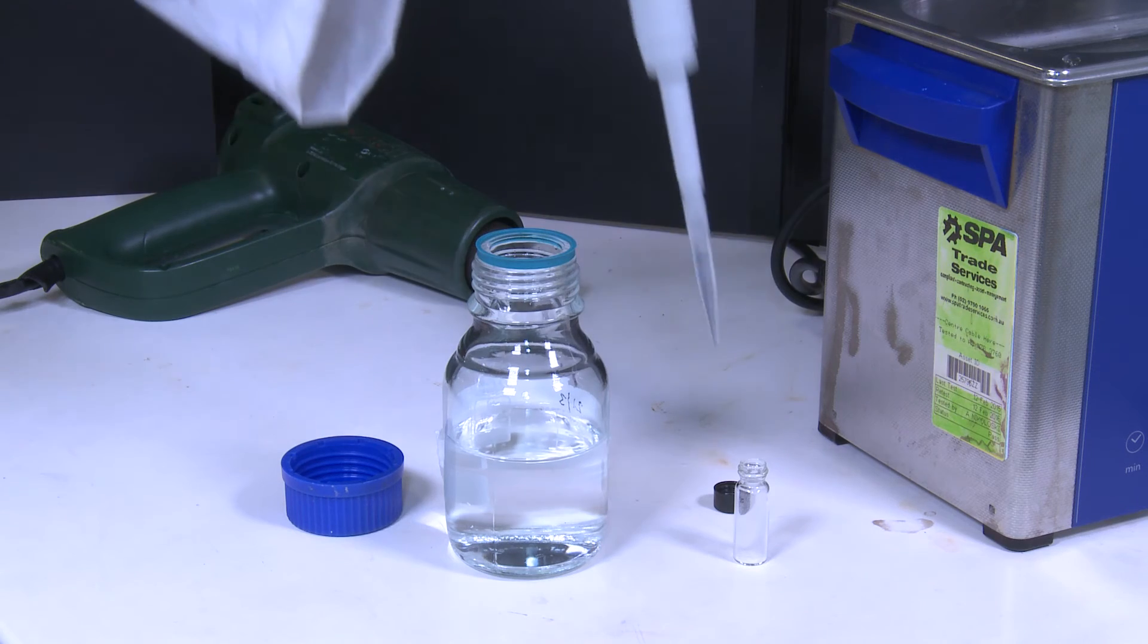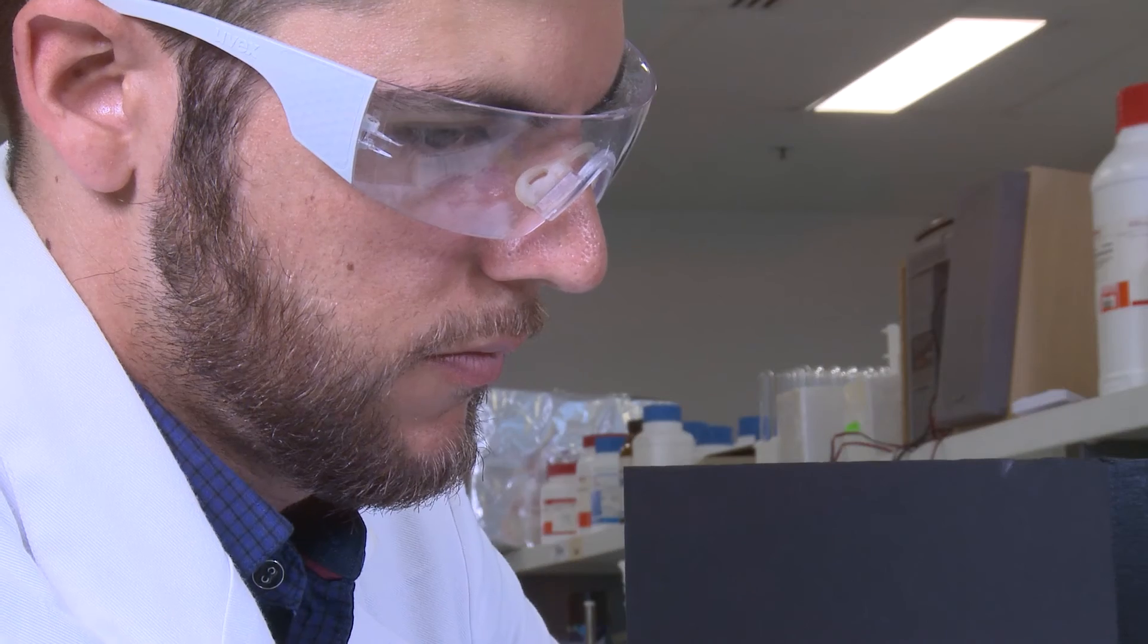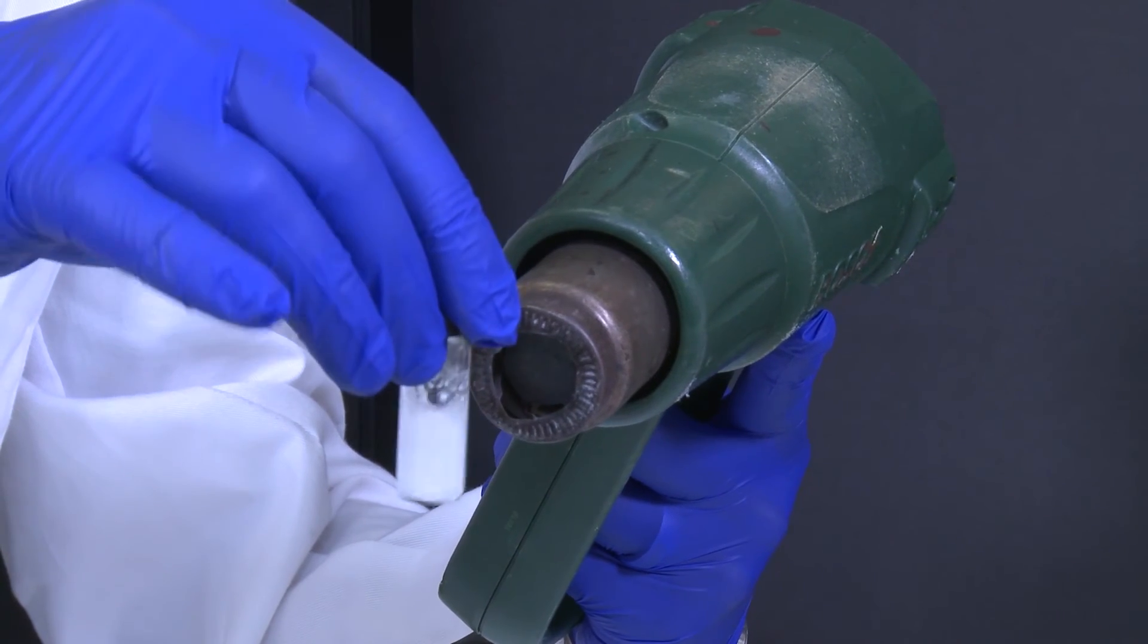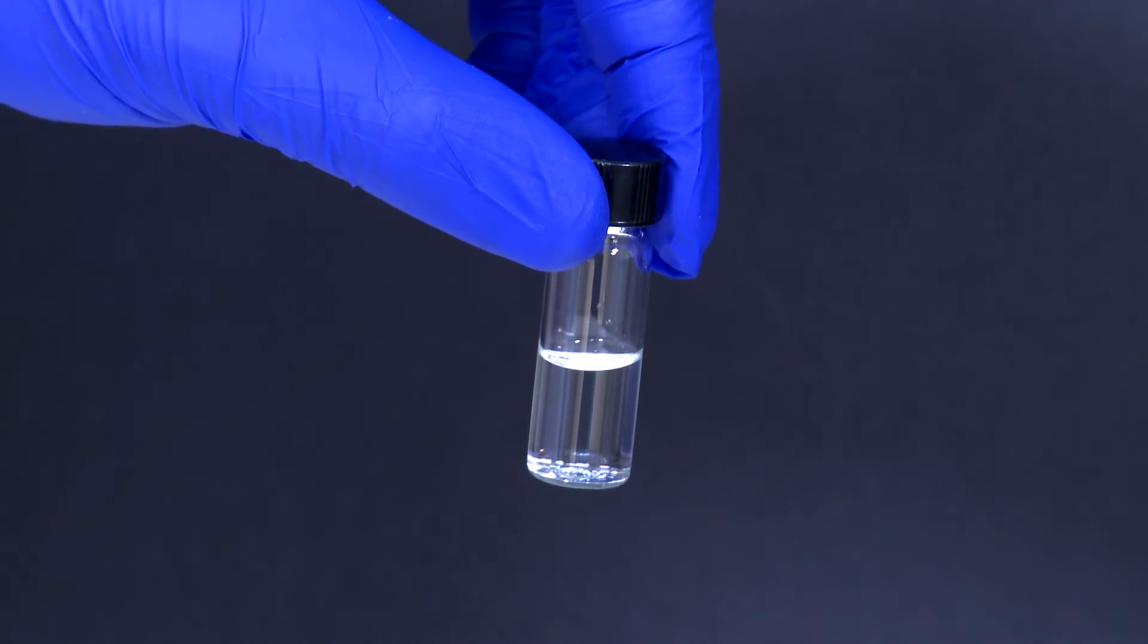Lastly, we use a heat cooling method. Add some phosphate buffered saline to the gelator and heat to dissolve before letting the solution cool.